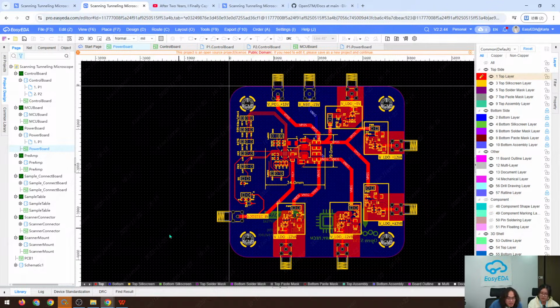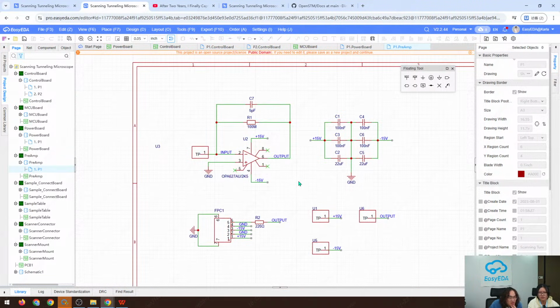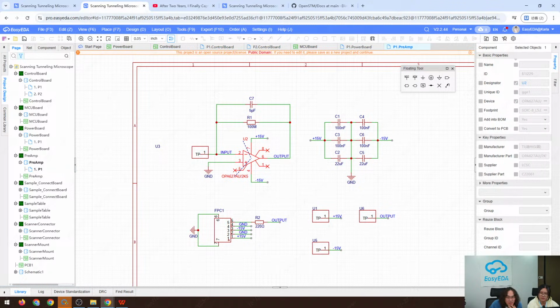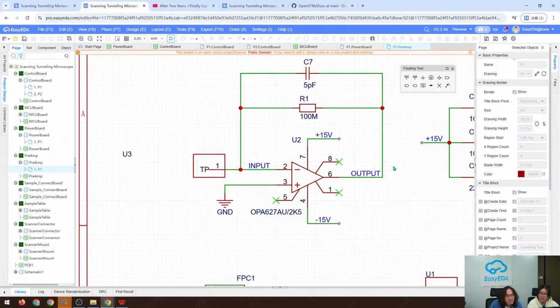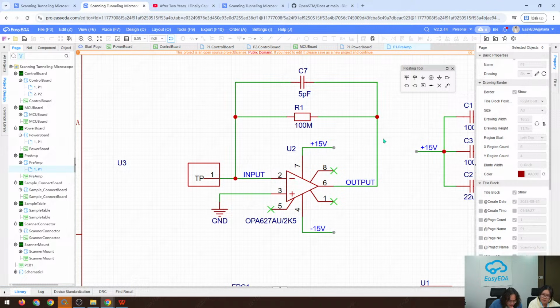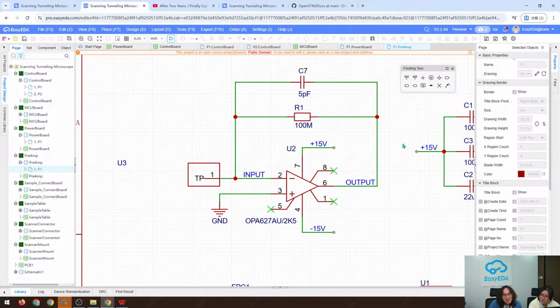Let's take a quick view of the other PCB, the preamp. The preamp is simply a TIA, and this is the OPA627. The reason I chose this chip is that the tunneling current is in the range of nanoamps, even picoamps, so we need a very small input bias current for our op amps. After balancing cost and performance, I chose the OPA627, and it works well.